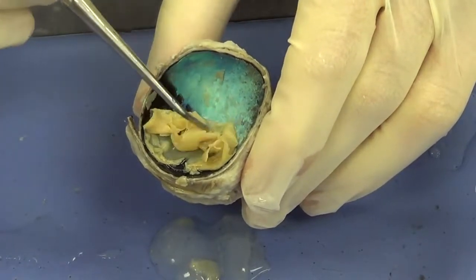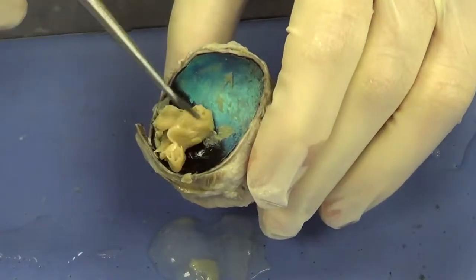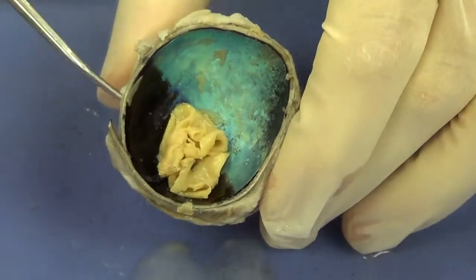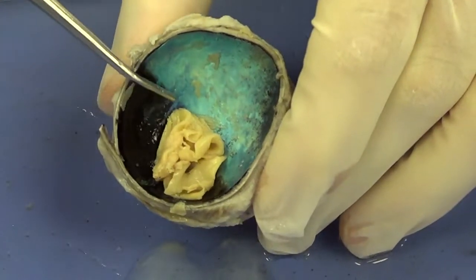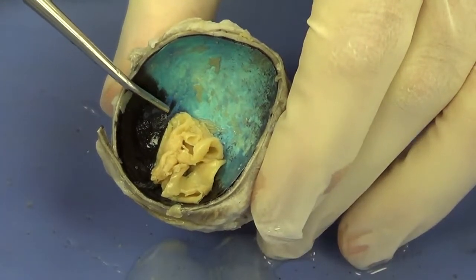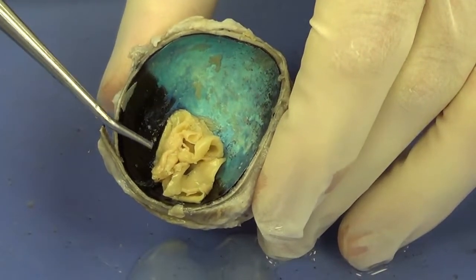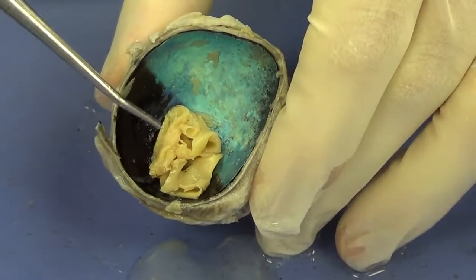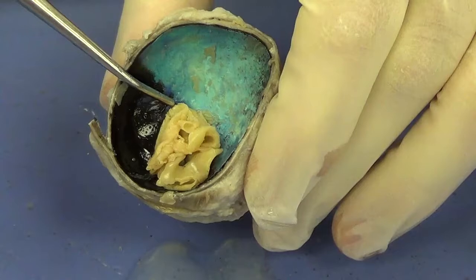In one place. And we're looking, there it is. You can see that one place right there where it appears as though the retina is passing through a hole in the eye. What that is, that's actually the axons of the nerves in the retina. All the axons of the nerves in the retina are passing through the back of the eye.